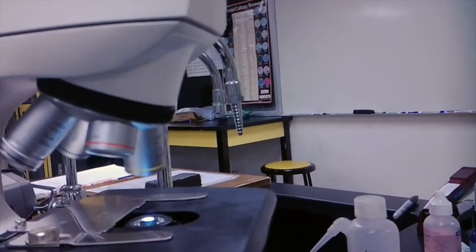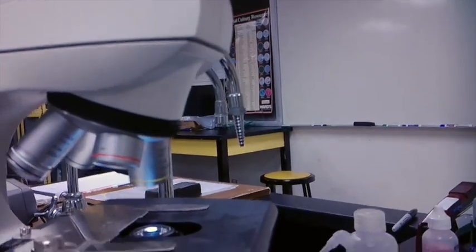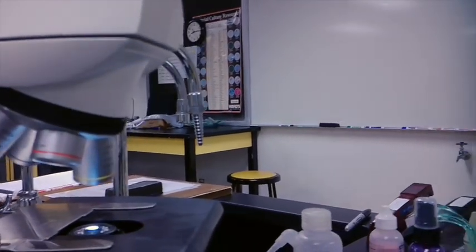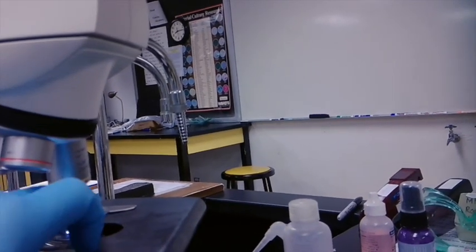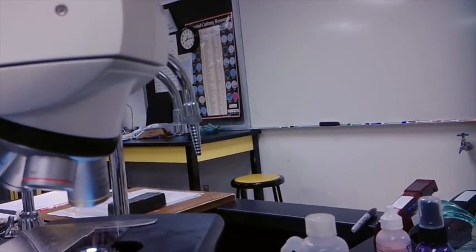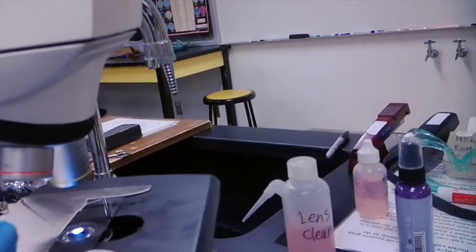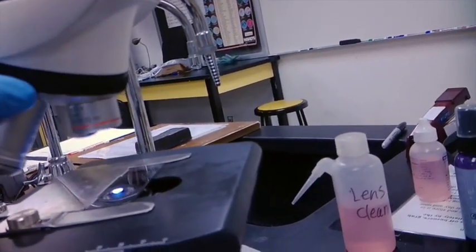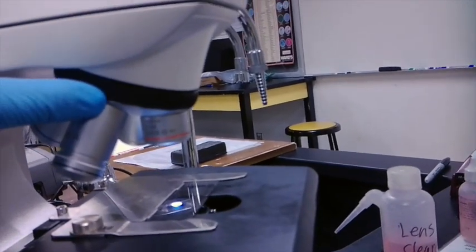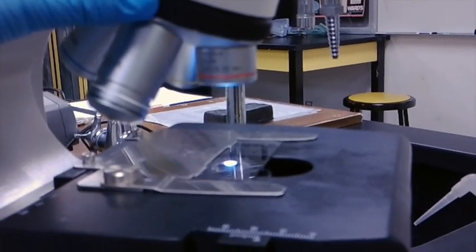So, now that we've covered our objective, let's talk about where you should start. So every time that you put a sample onto the stage, you're going to want to get the stage set such that you see some of where your stained sample is, and you'll always start with the lowest magnification lens. So in this case, it's our 4x lens. This is our scanning lens, our scanning objective.